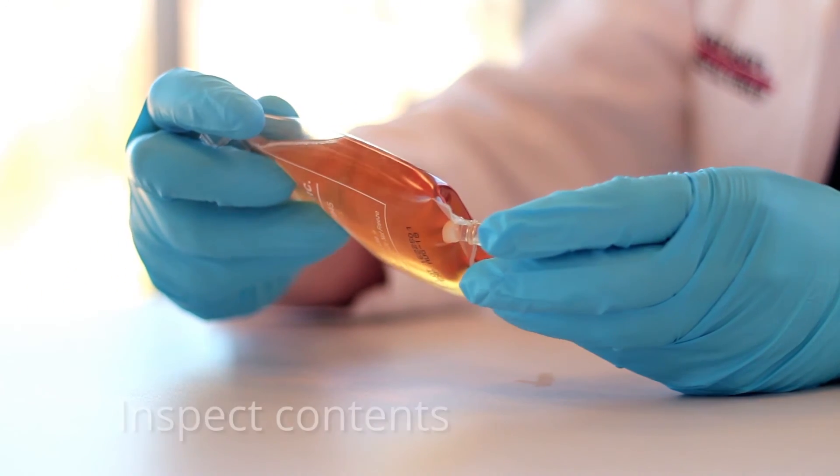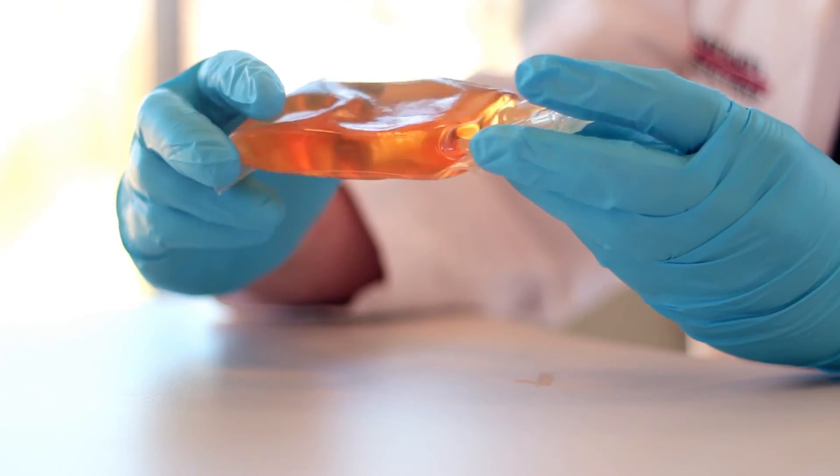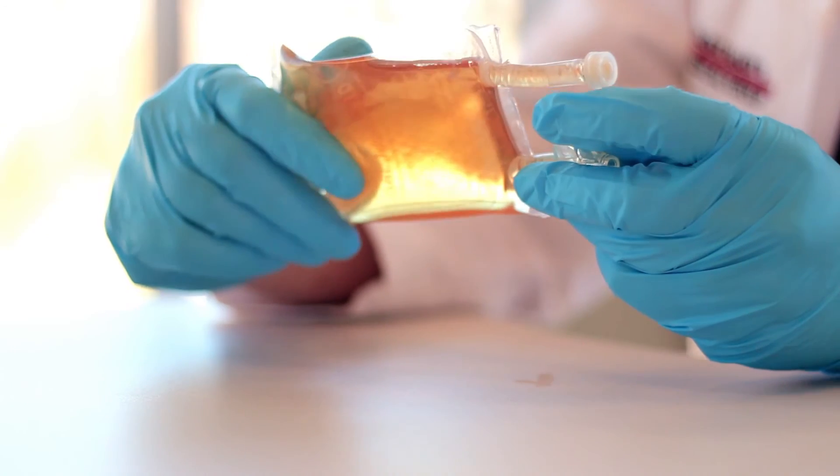Immediately inspect the final container contents for particulates, corings, and fibers. These particles should not be recorded as microbial growth.